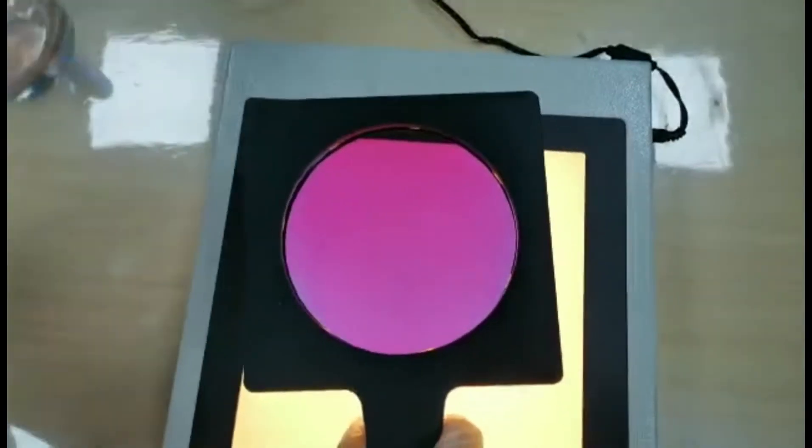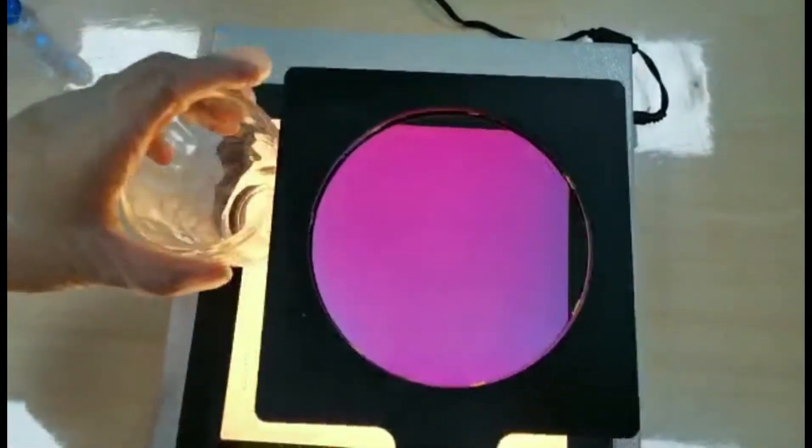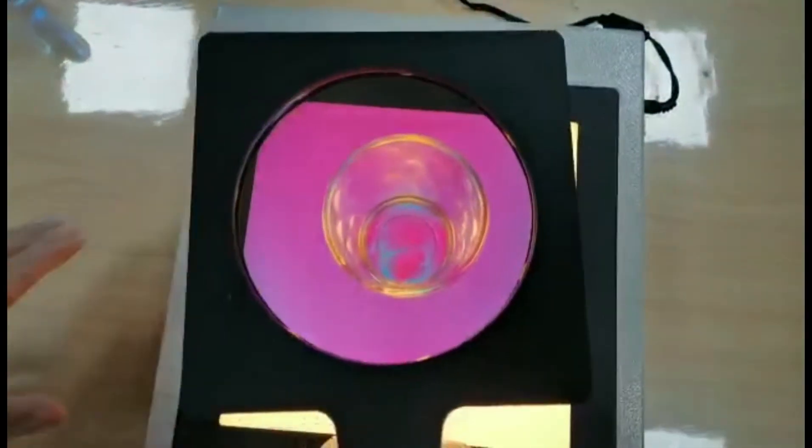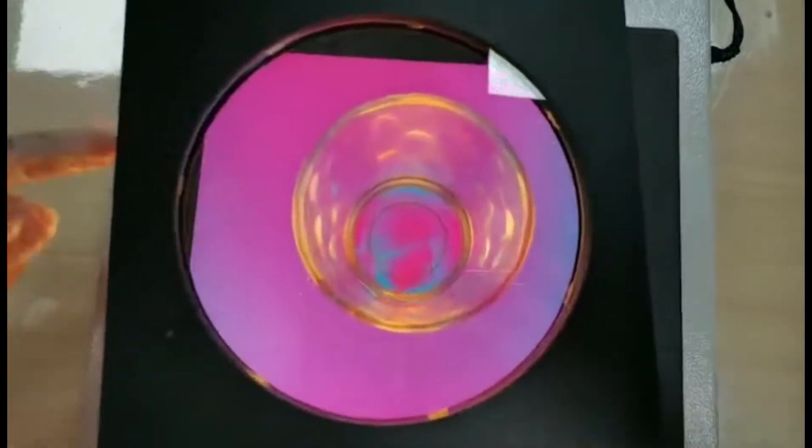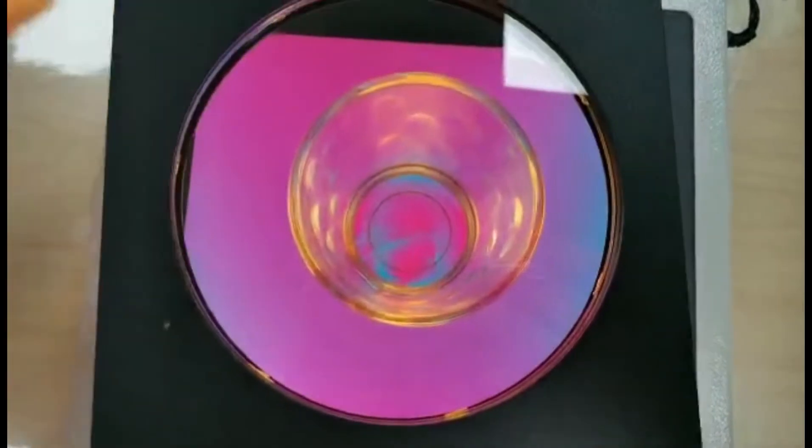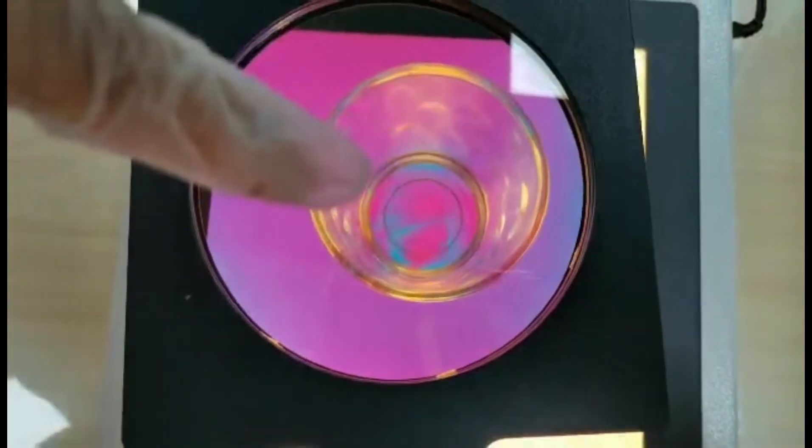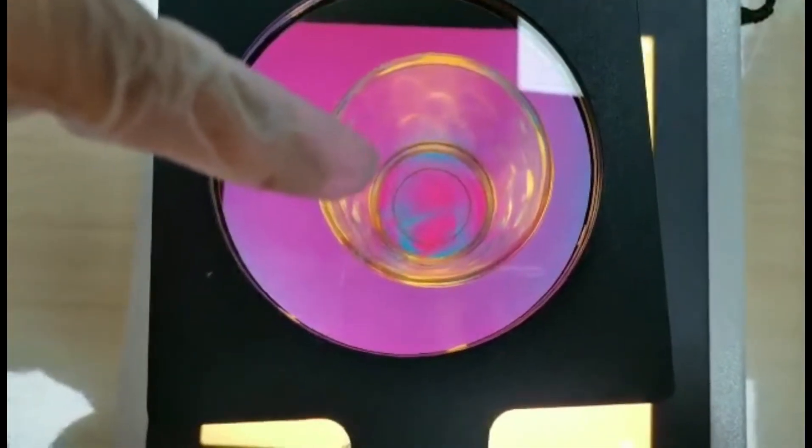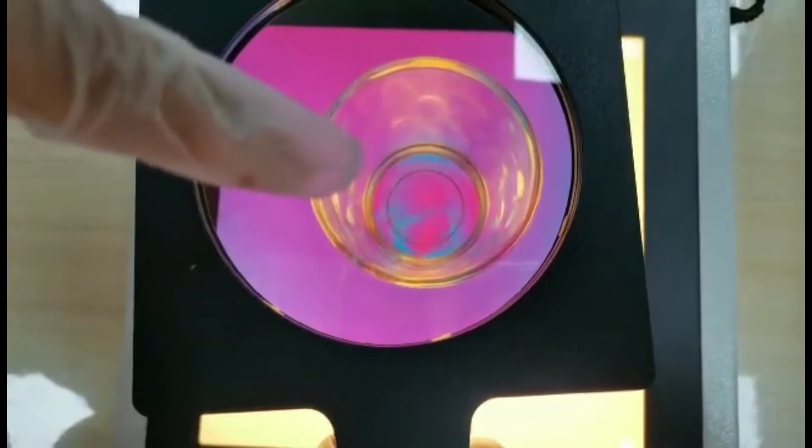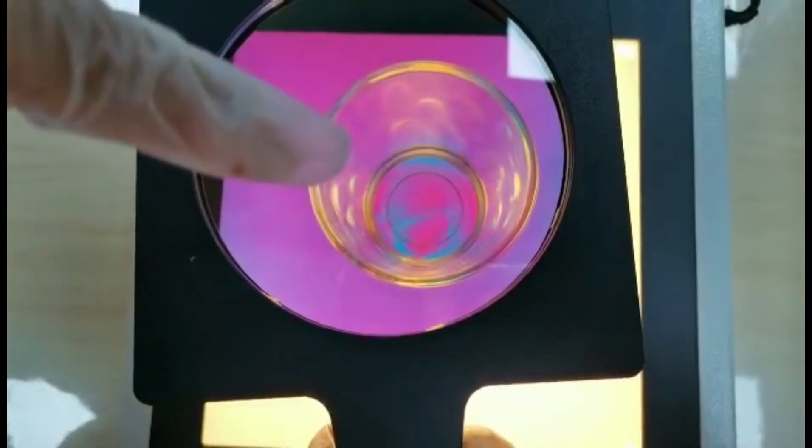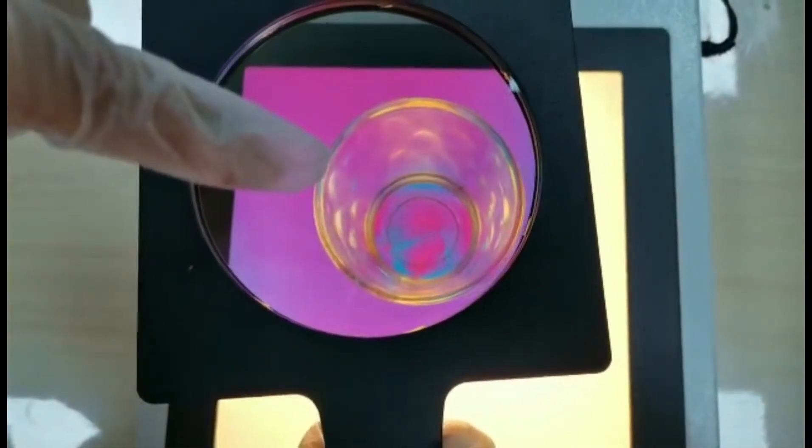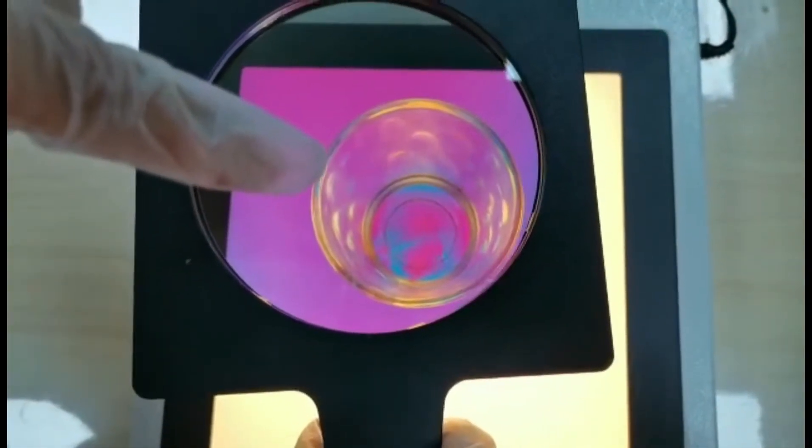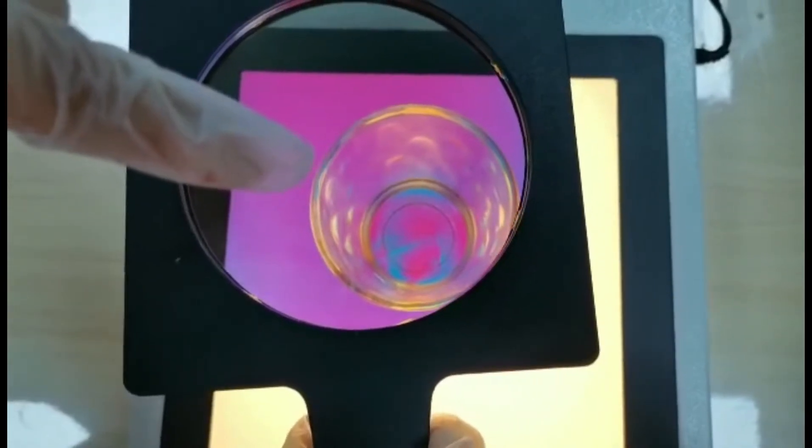Now, put a cup glass between the analyzer and polarizer. We can see clear blue areas in the base, which indicates the stress presence in this blue area. This condition can be well improved by changing some annealing conditions.